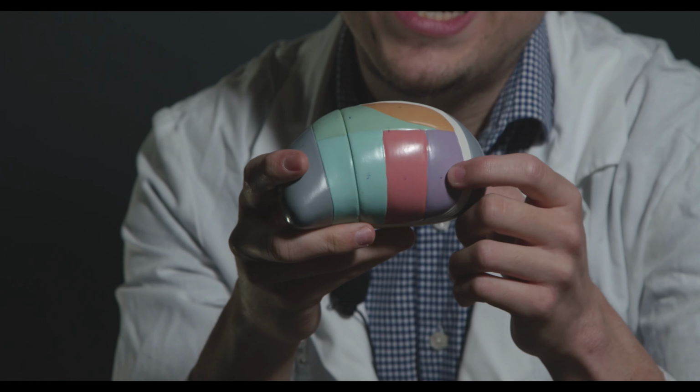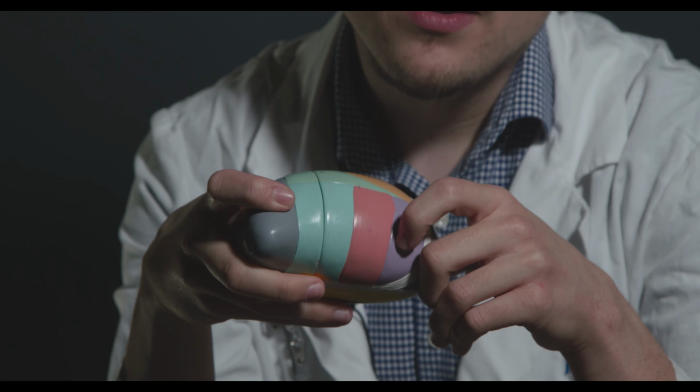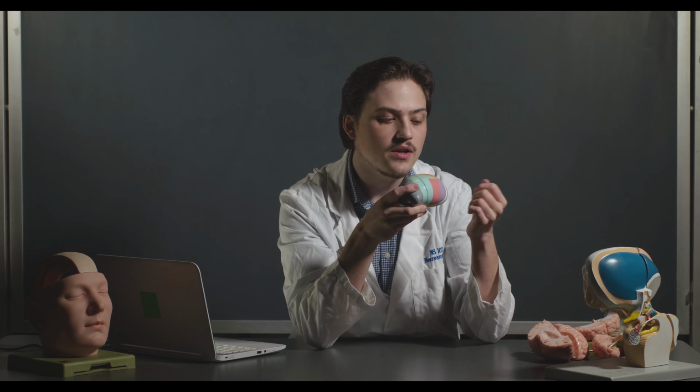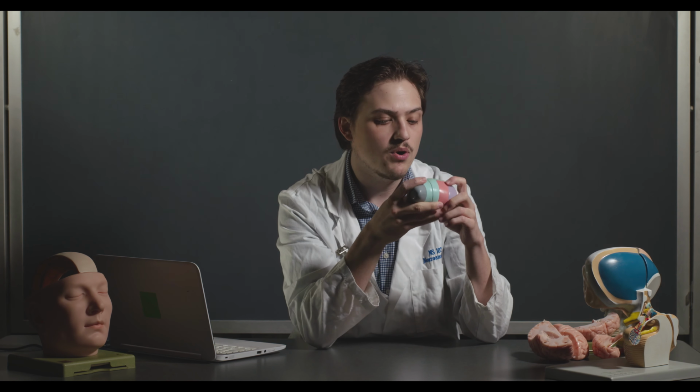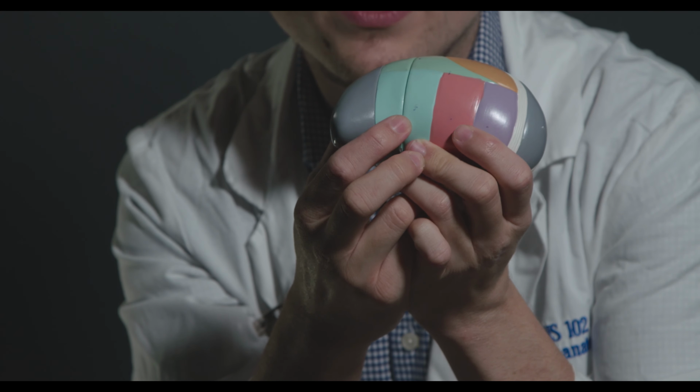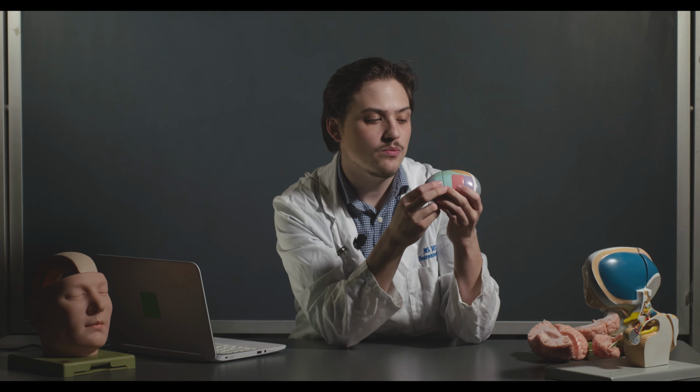Then there's the ventral anterior nucleus, which is this guy right here. The ventral lateral nucleus, both of which are essentially involved in motor behavior. So there's synapses here that are involved in a lot of the different motor areas of the brain. Then there's the ventroposterolateral nucleus, which is a sensory relay station.